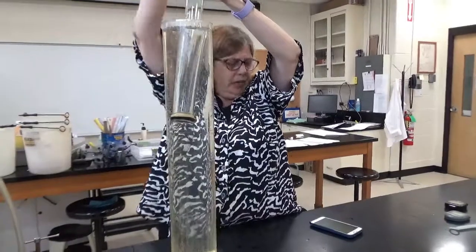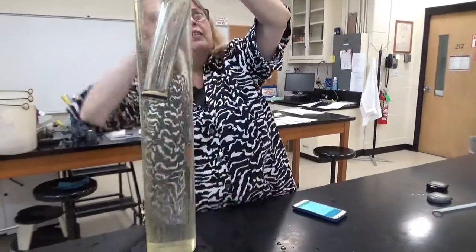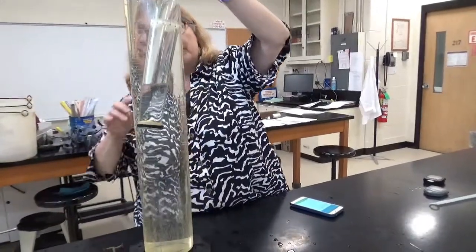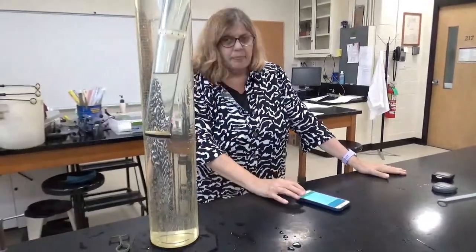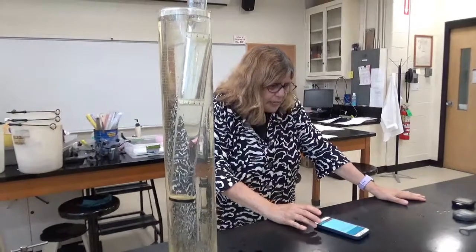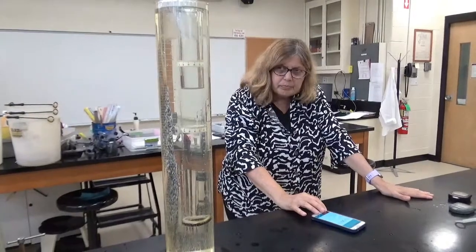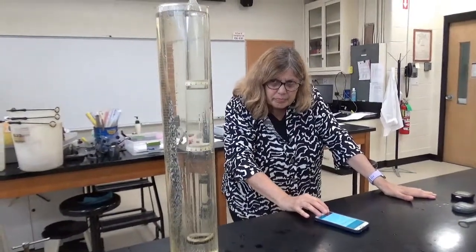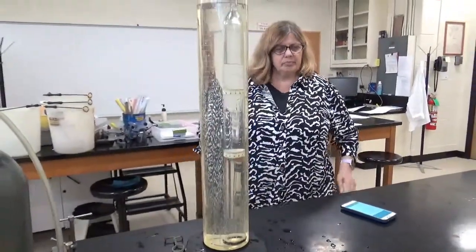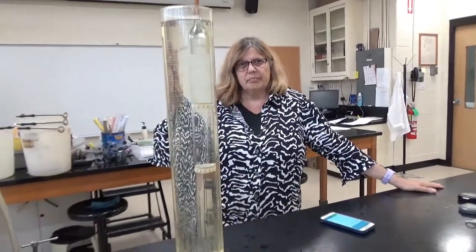Okay, now I just get your cell phone ready. I'll take this off. When it gets to the bottom of the bottom tape, I'll say start. Start. Stop. Okay, so we're going to write down our numbers, and we want you to keep your number as well.